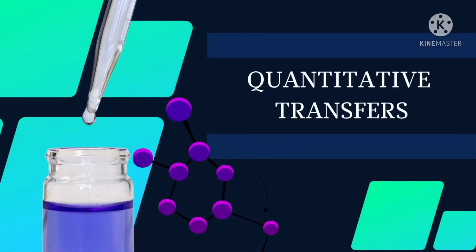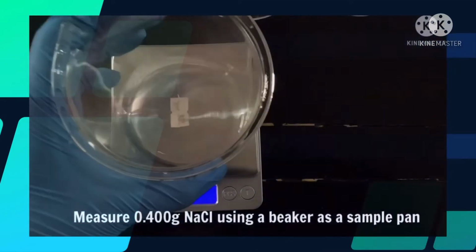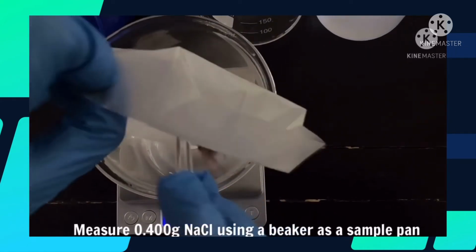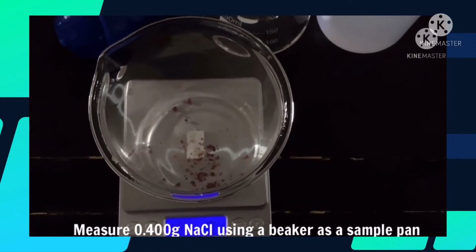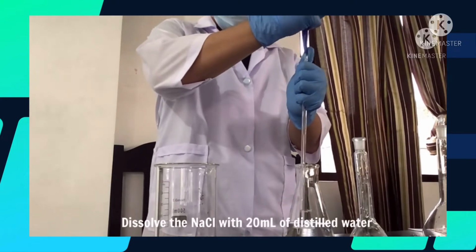For the second part, let's now proceed to the quantitative transfers. First, using a beaker as a sample pan, measure approximately 0.400 grams of NaCl. Make sure to press the tare button before placing the NaCl. Then dissolve the weighed NaCl using 20 ml of distilled water.